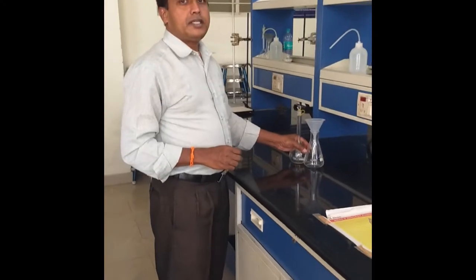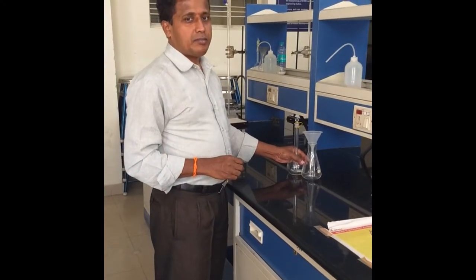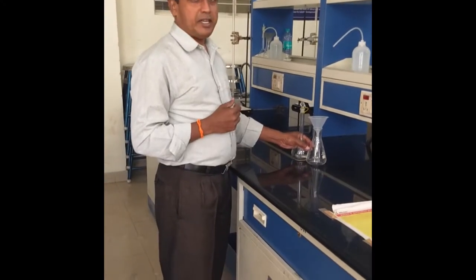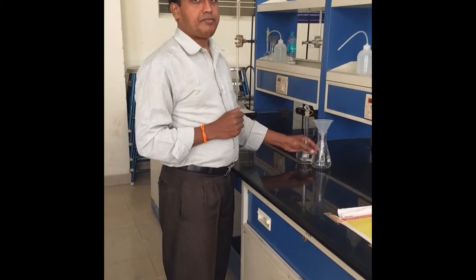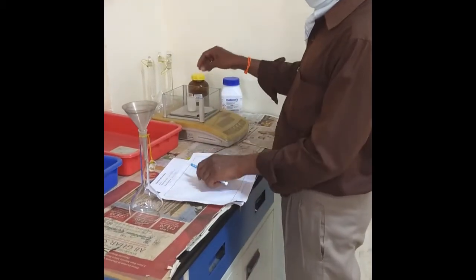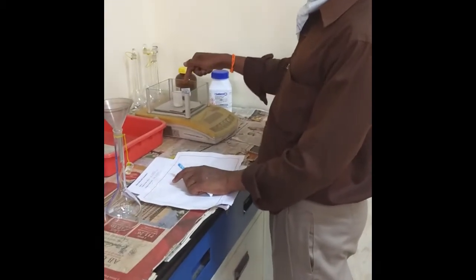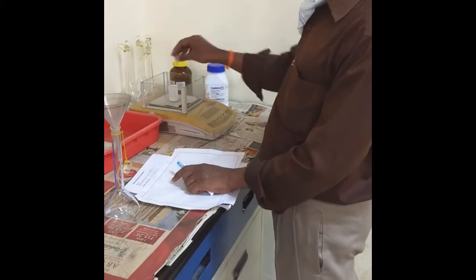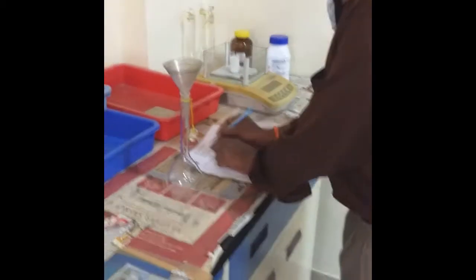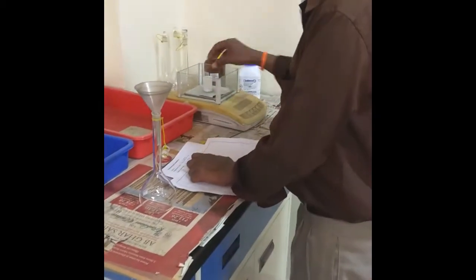Today's experiment is estimation of percentage of calcium oxide in a given sample of cement. For EDTA crystals, the weight of EDTA plus weight of the weighing bottle W1 is coming to 5.833 grams.